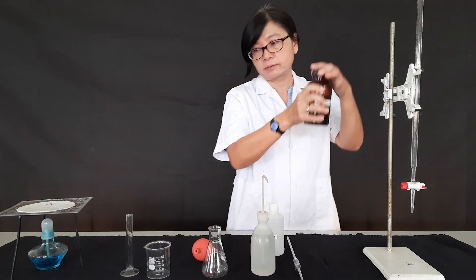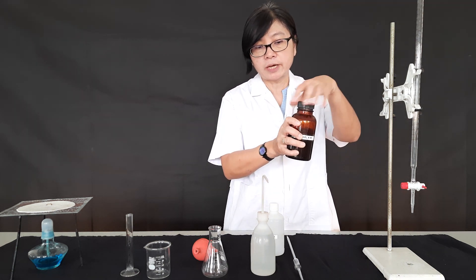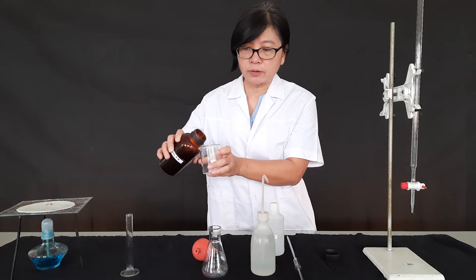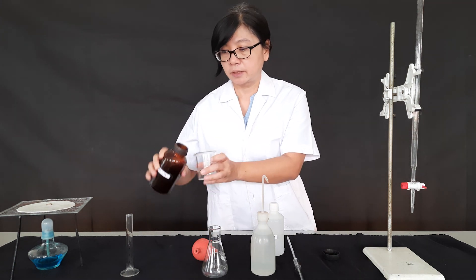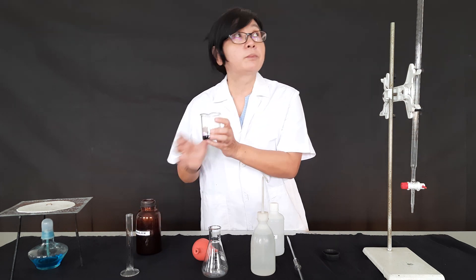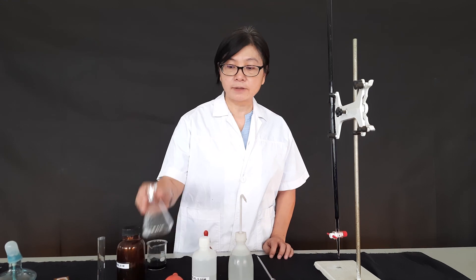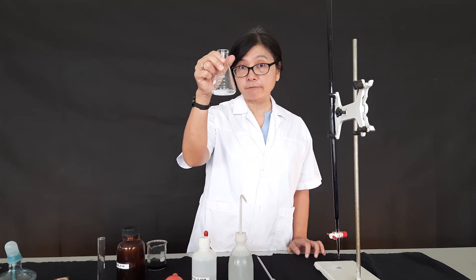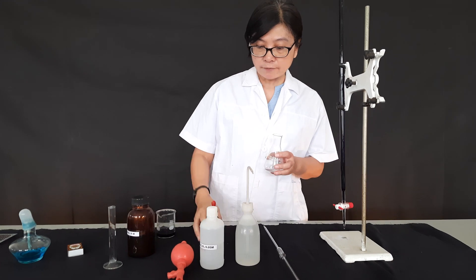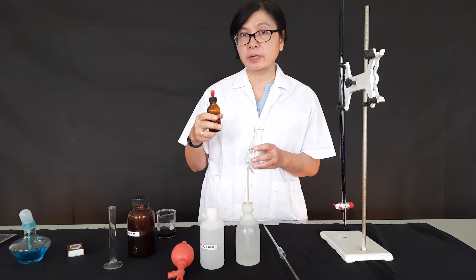For the KMnO₄, we put it in the burette — we need the help of a beaker to pour it in. So we have oxalic acid in the conical flask, and we also need to add sulfuric acid as the condition for the reaction.